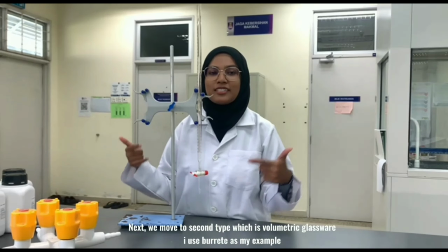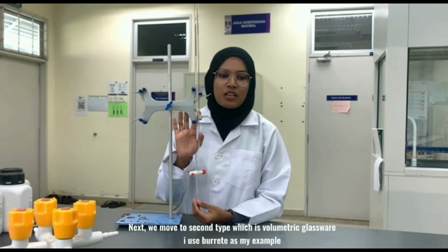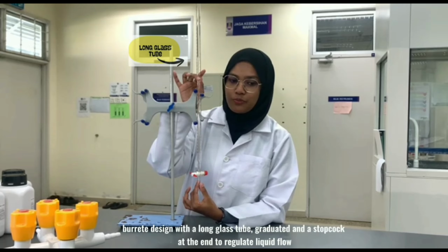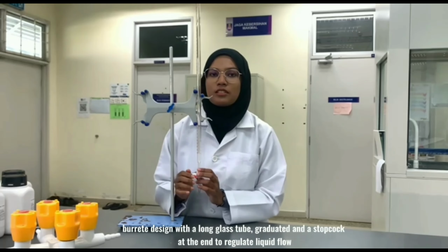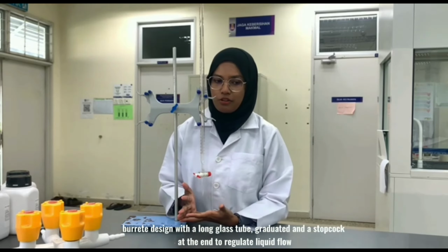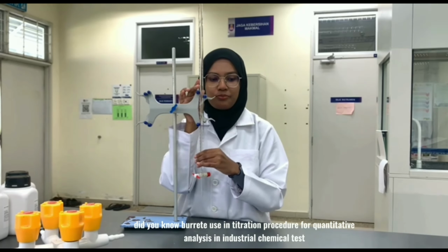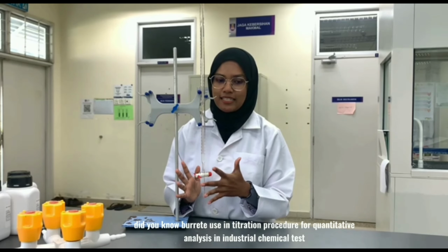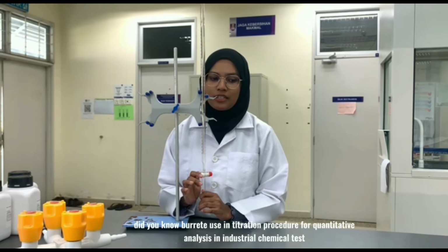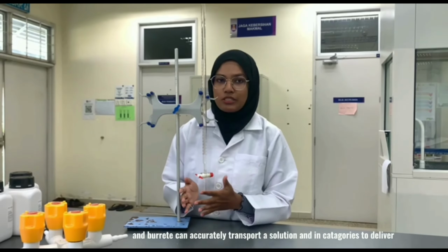Next, we move to the second type, which is volumetric glassware. I use burette as my example. Burette is designed with a long graduated glass tube and a stopcock at the end to regulate liquid flow. Did you know burette is used in titration procedure for quantitative analysis in industrial chemical tests? And burette can accurately transport a solution and is categorized as to deliver.